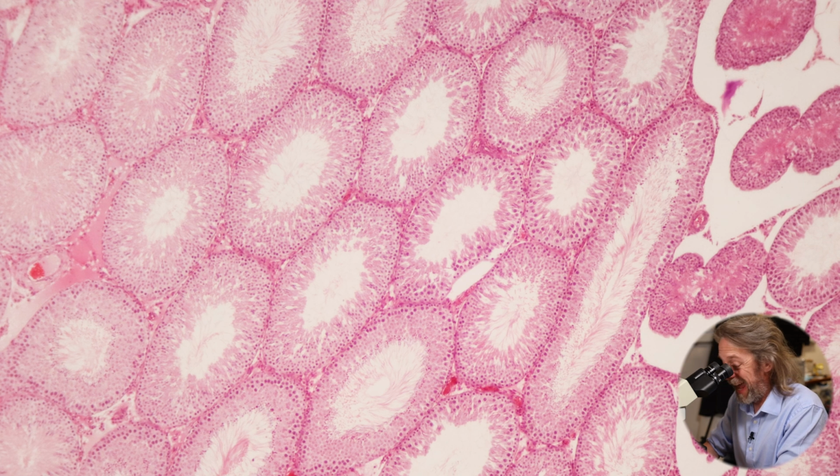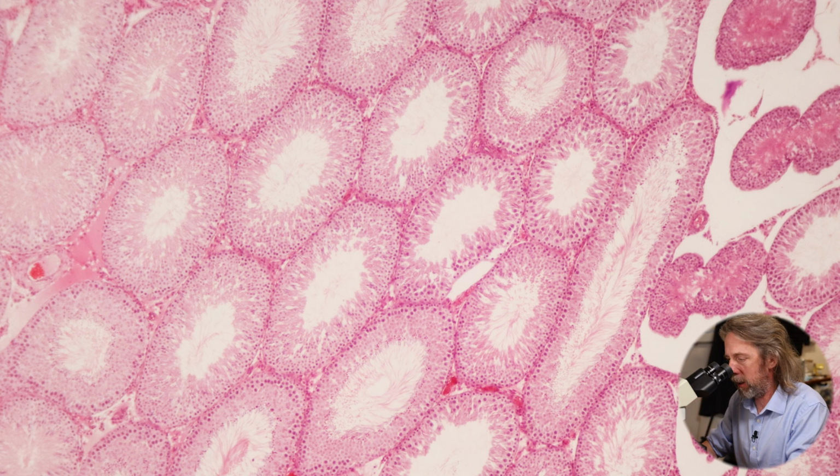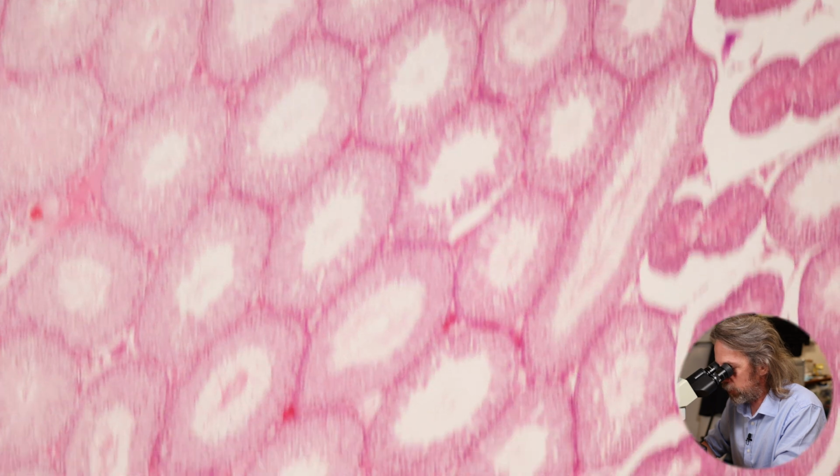And in the edge of the tube, we're seeing a special epithelium, we're seeing germ cells, and those germ cells are going to become spermatozoa, get released into the center of the tube, get moved along the tube, and they're going to mature somewhere else, and then they'll get released if needed for fertilization, right? So we're maximizing the surface area by getting as much tube as possible packed into the testis to give as many germ cells and produce as many spermatozoa to increase the chances of fertilization, right? Fertilization, reproduction are massive drivers of evolutionary changes. So that's what we're seeing there.